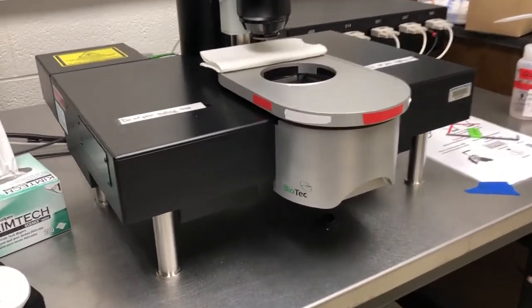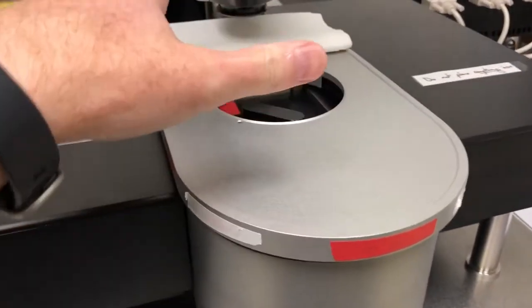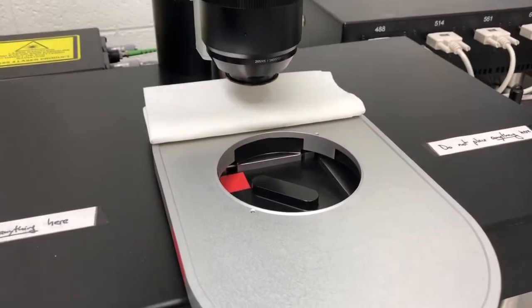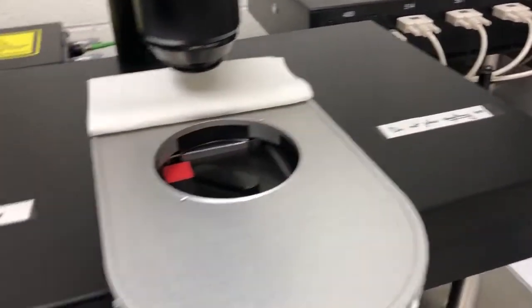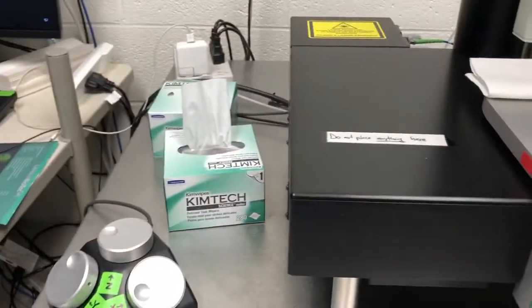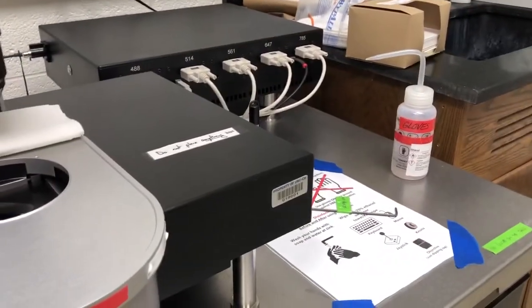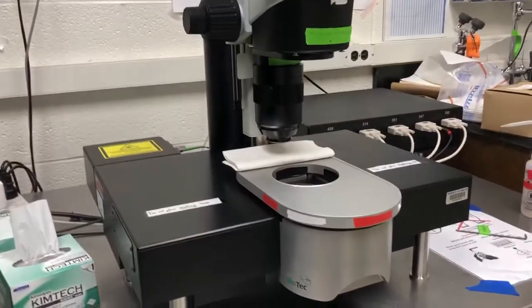The second thing is, as you're manipulating samples, you may get little bits of DBE here. As you're moving things, I'll show you ways of minimizing that, but it's inevitable that you might get a few drops. Please clean those immediately with ethanol and Kim wipes. We have Kim wipes there, ethanol is there, to minimize the chance of any damage to the system.